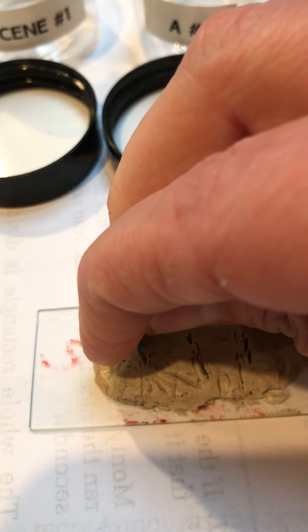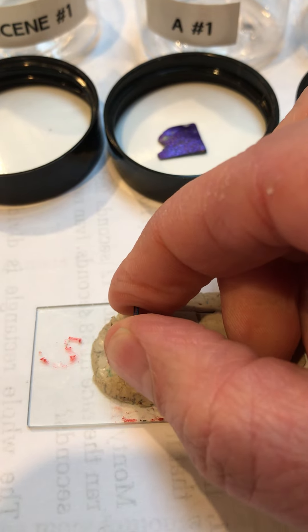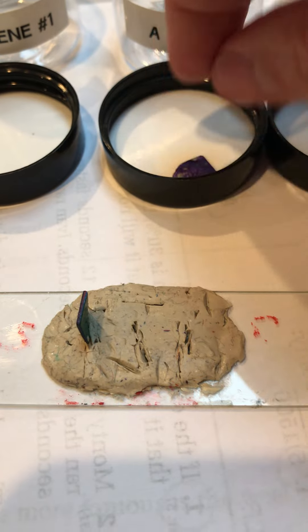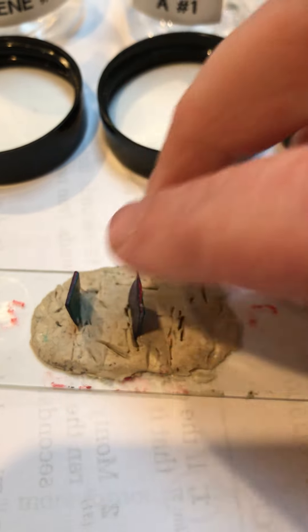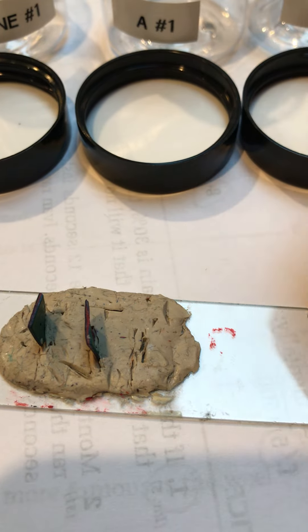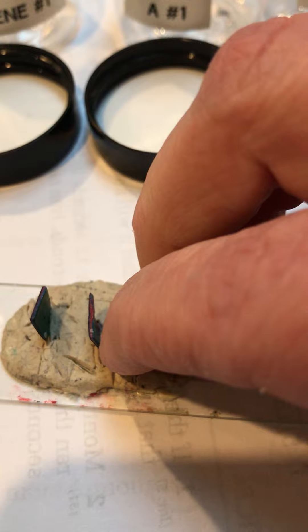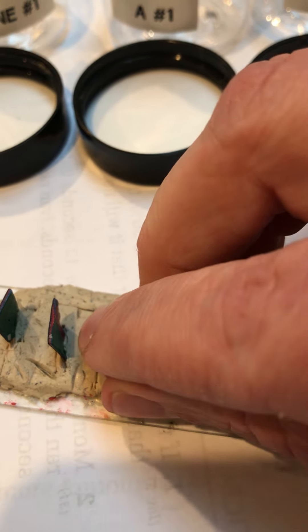Once we do that, we're going to place our paint chips edge-up into our little slide here that's been covered in modeling clay. Modeling clay allows the paint chips to stand up so that we can see their edges. Just carefully place the paint chips edge-up — you have to handle them fairly carefully because they are pretty brittle and can easily break. Make sure the edges sticking up are the ones that show the most layers.